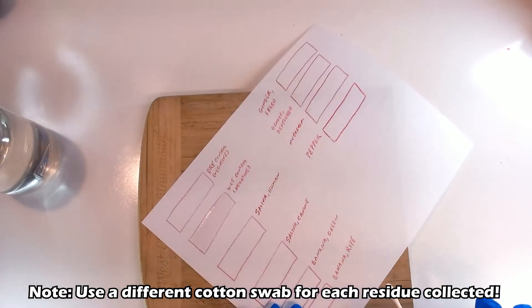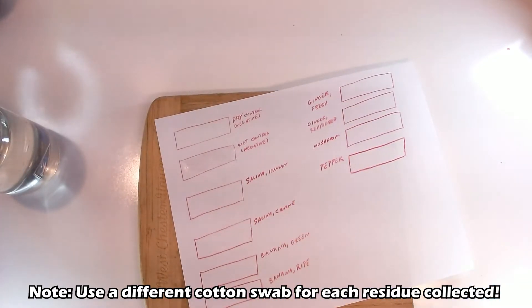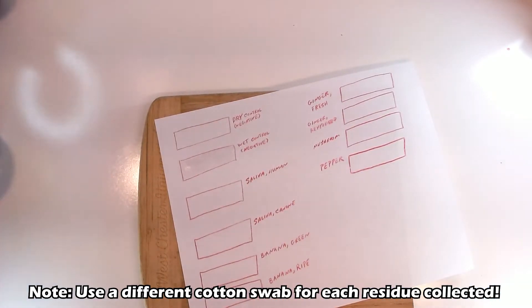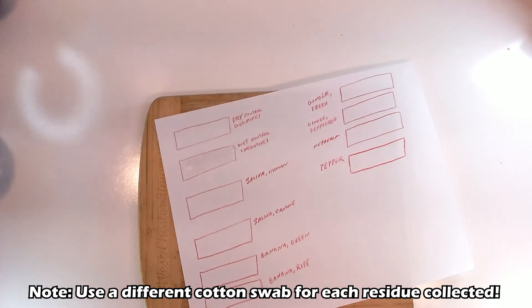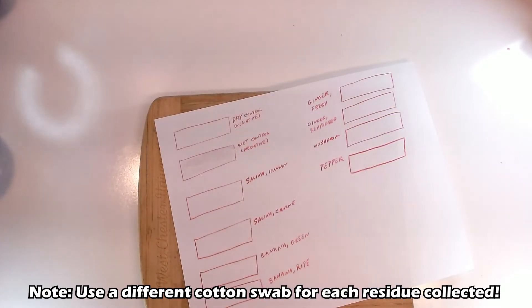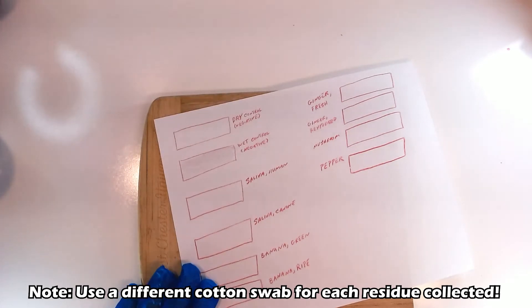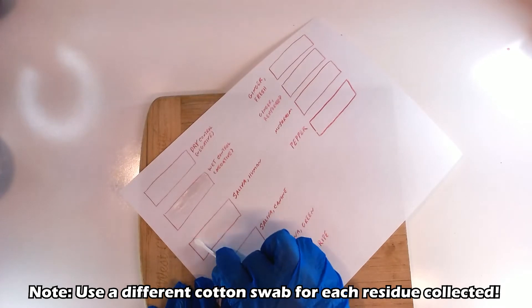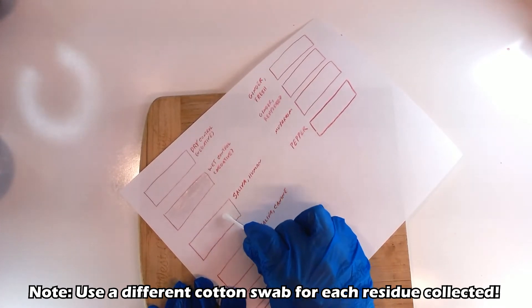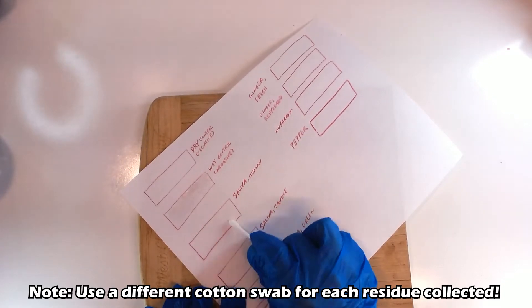I'll test two different types of bananas: a very fresh green banana, still very starchy, and a ripe banana with spots. I'm going to test two different kinds of ginger as well — fresh ginger root and powdered ginger that I've mixed with some water — to see if I get a different result. I'm also going to test some wild cards: a mushroom that I got from the store and a red pepper that I got from my garden.